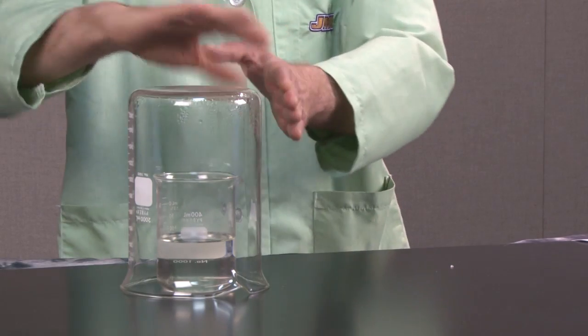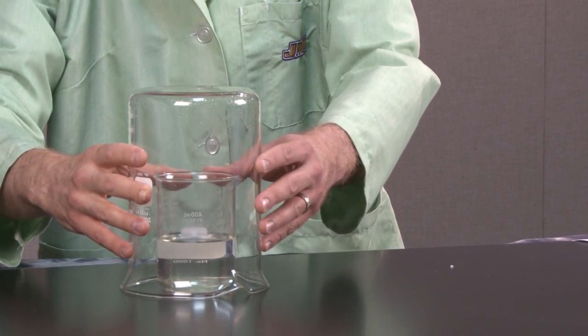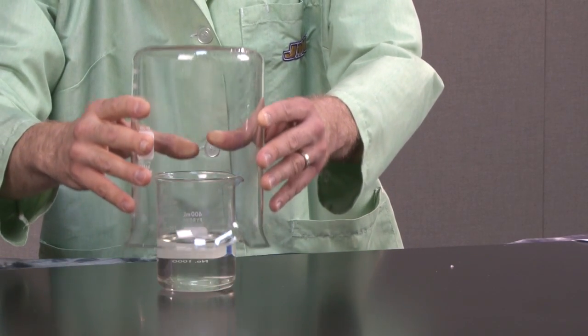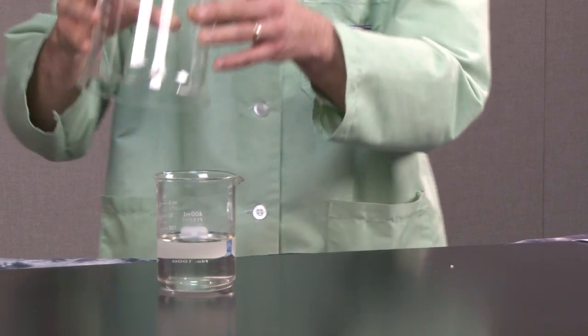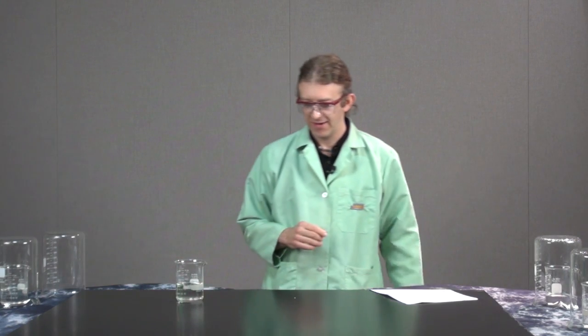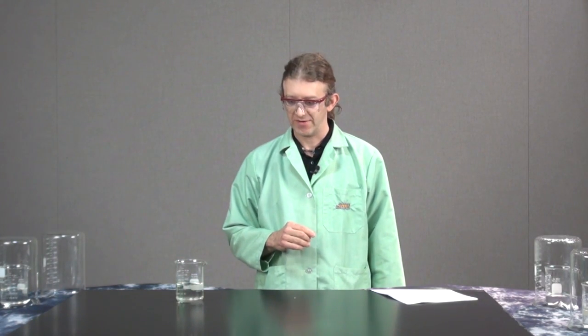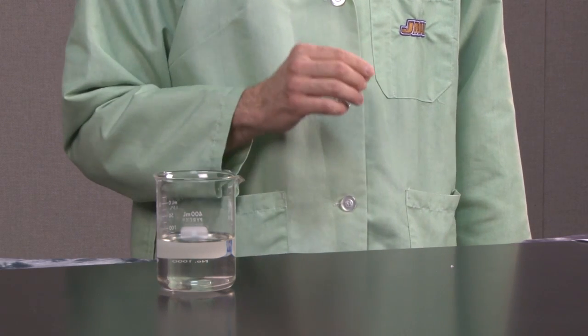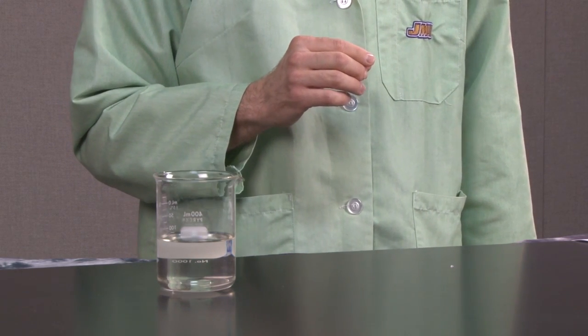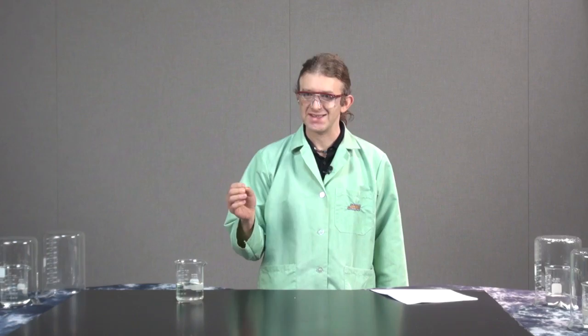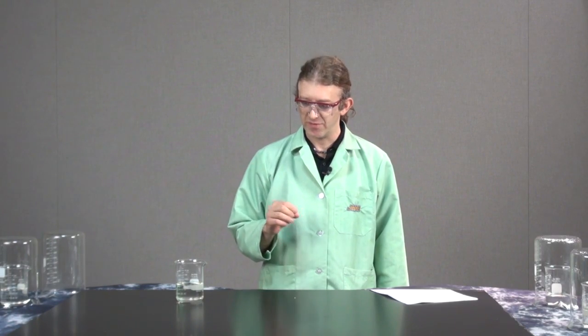And we've kept it covered with a beaker overnight so that no dust particles get in there, because very small stimuli can actually start the crystallization process. So there are a number of ways that I can start crystals forming in this supersaturated solution. This is a metastable, non-equilibrium system.